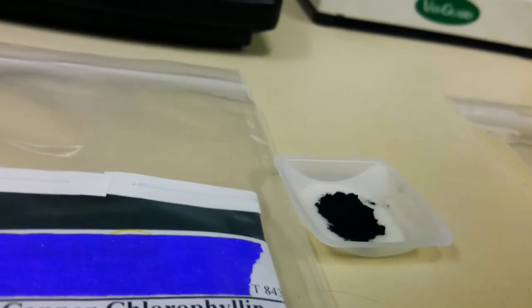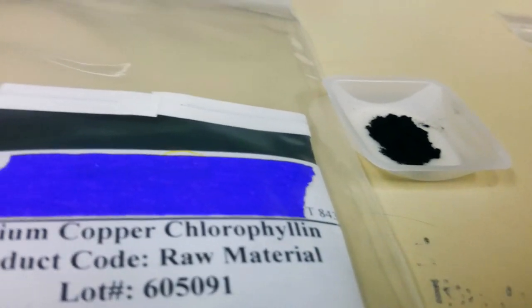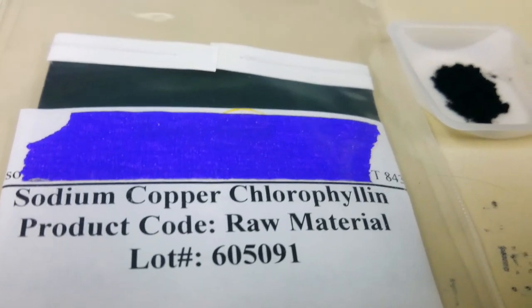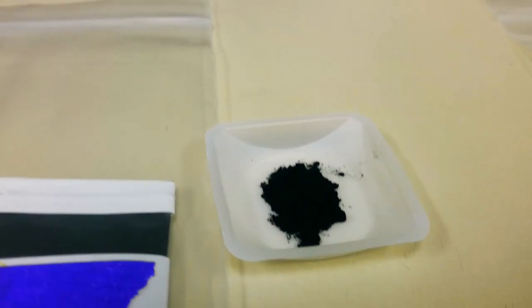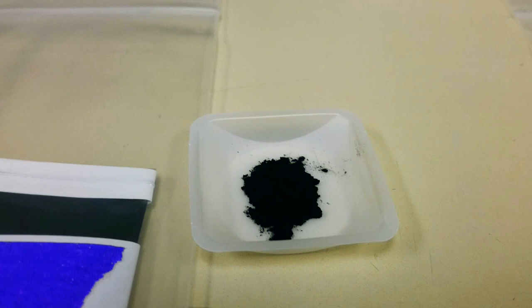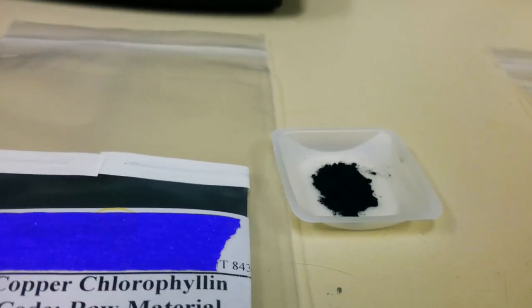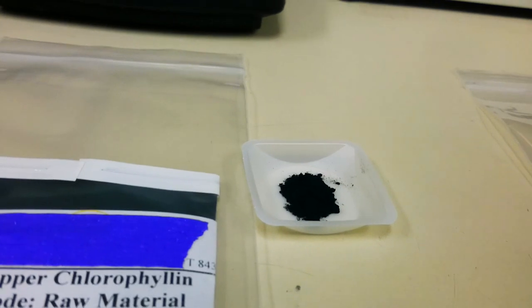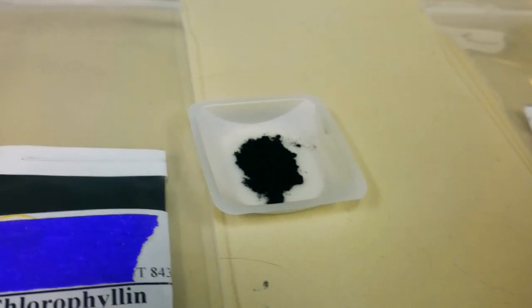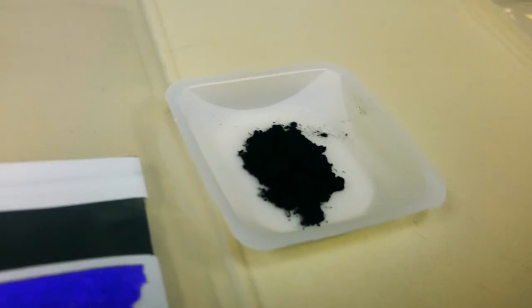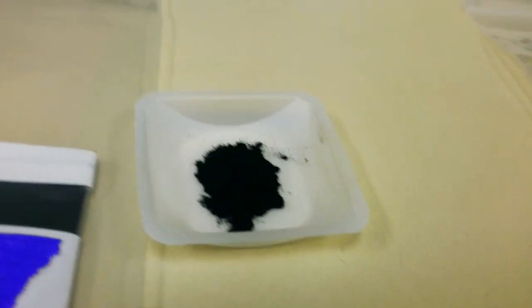This one is sodium copper chlorophyllin. I liked this one because right now it looks really dark, this kind of dark color.